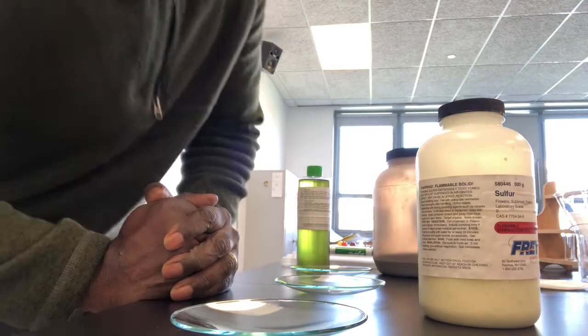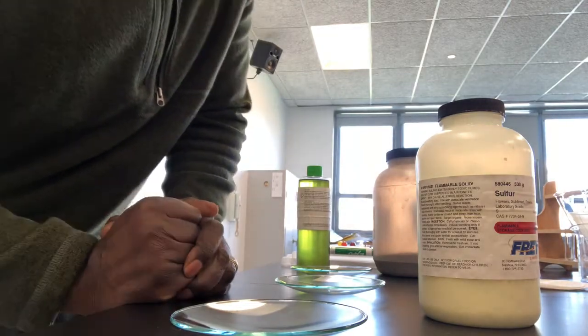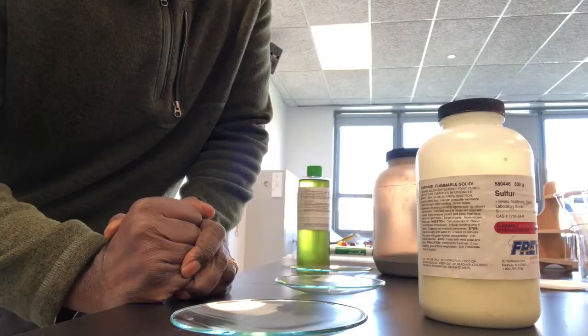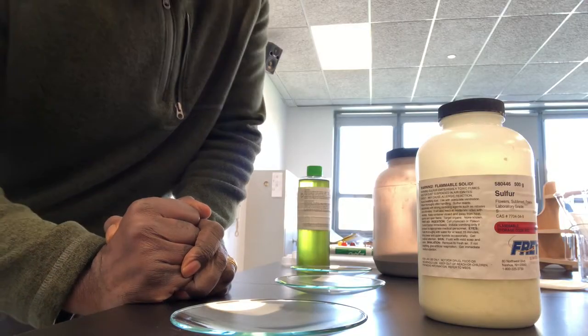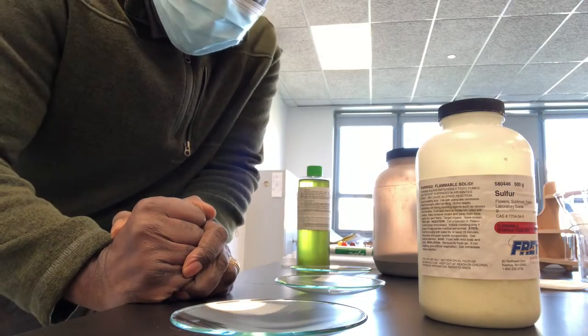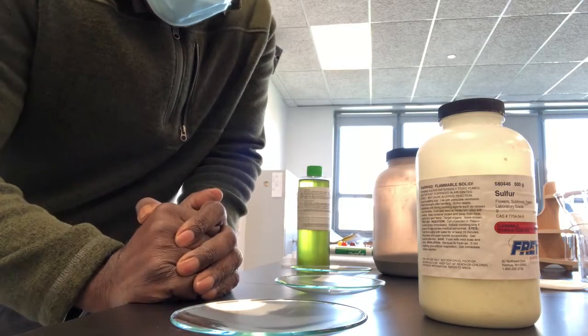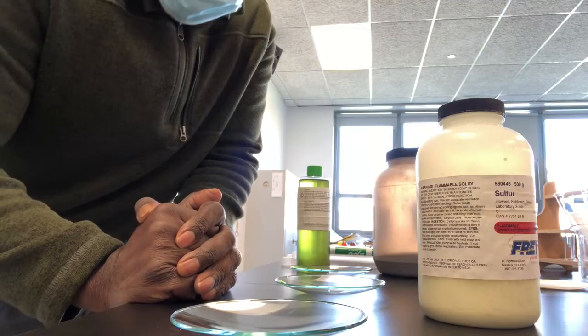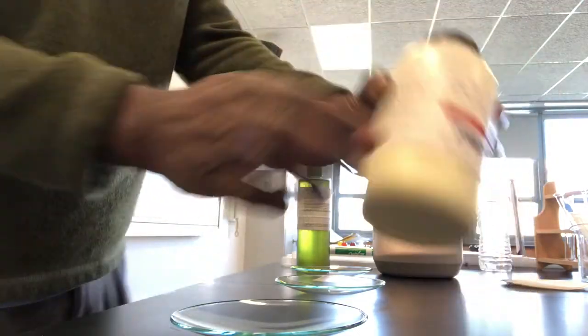Hey guys, I'm back. What I'm going to do right now is a few simple demos on elements, compounds, and mixtures. Primarily, we'll talk about mixtures. Okay, so here we go.